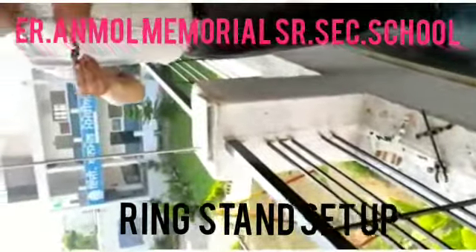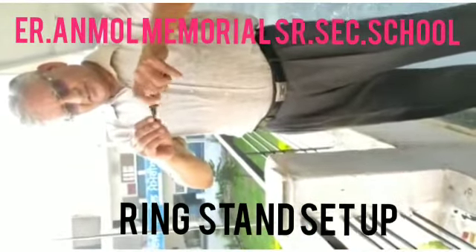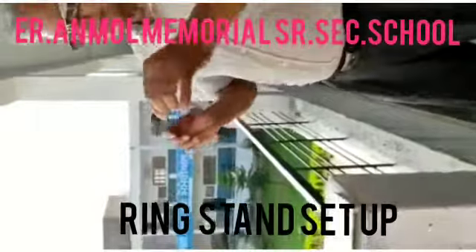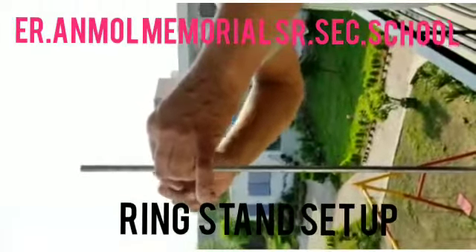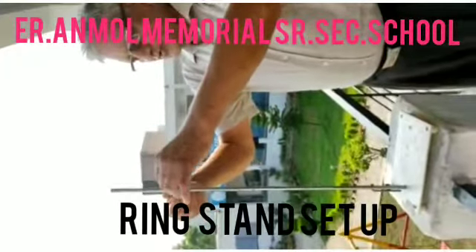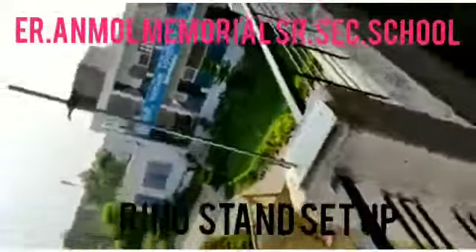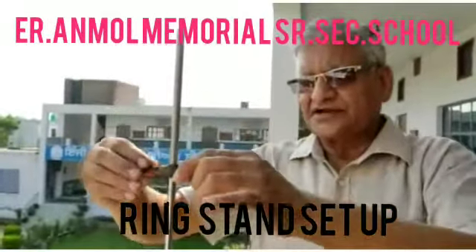There is one thing here. On both the sides you can make big holes or small holes. One of the two sides you want to fit here. Take care that you can shift it upwards or downwards only by adjusting this screw. This is the screw by which you can adjust it upwards and downwards.